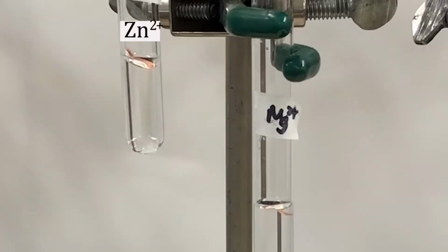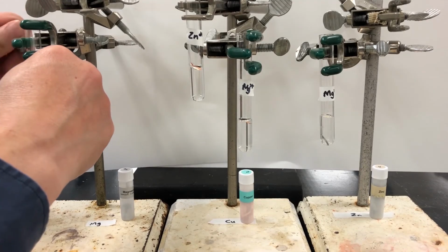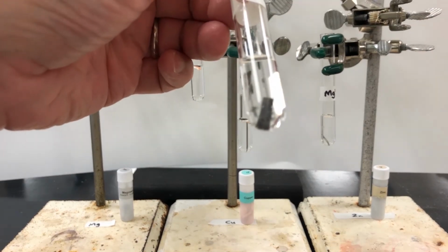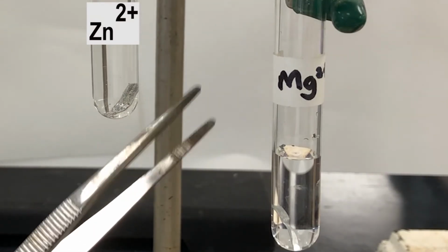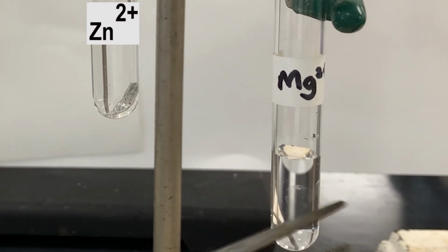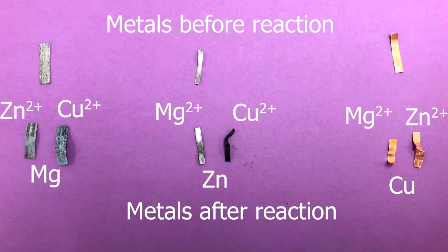The reverse, copper solid, doesn't appear to react at all. Now you could decide whether magnesium reacts in aqueous zinc 2+, or zinc solid reacts in aqueous magnesium 2+. Maybe having the metals out of solution might help.